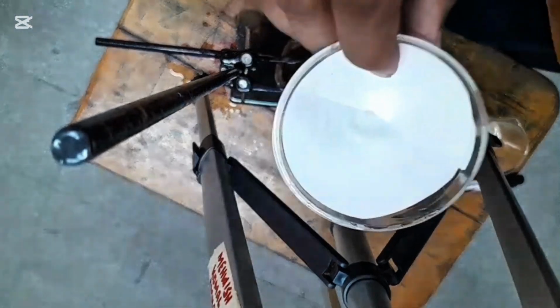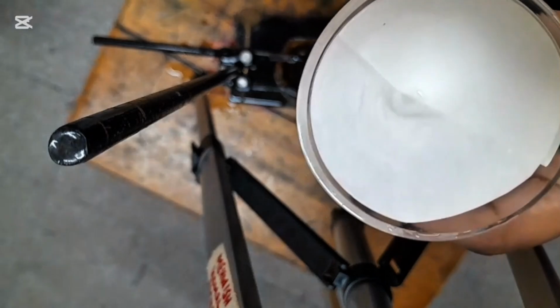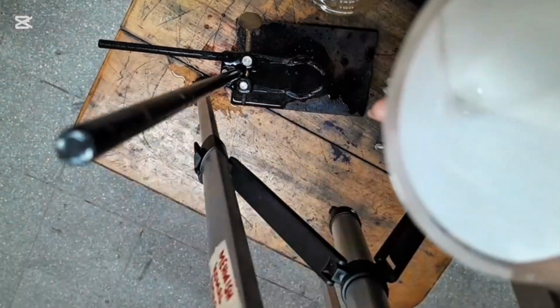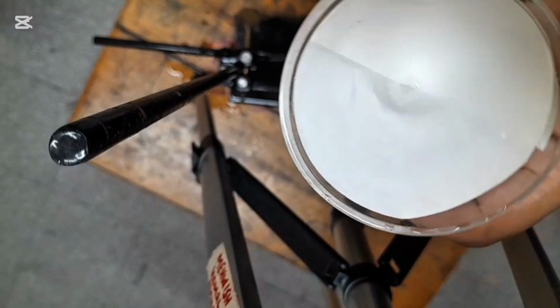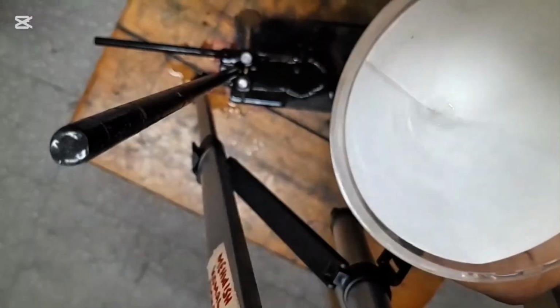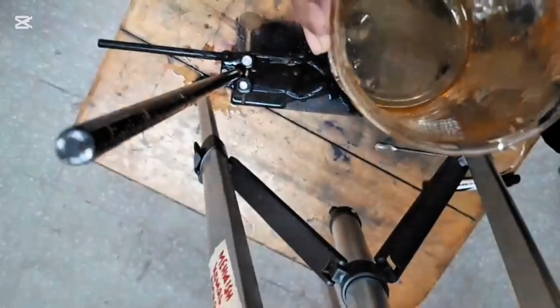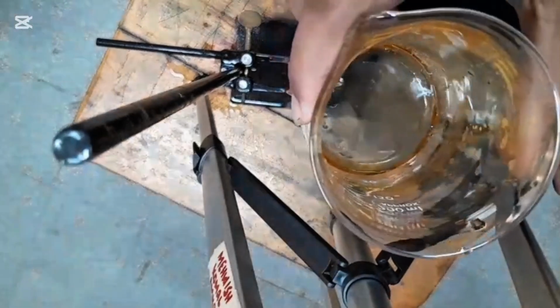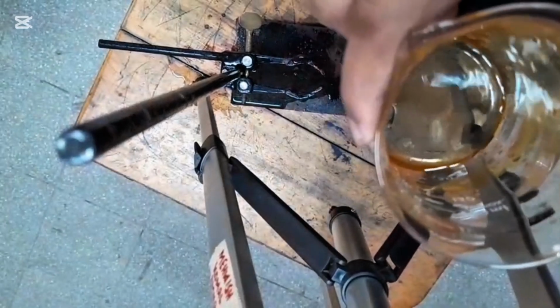So you can see all the water is getting filtered from this filter paper. This is your funnel, in which we attach a filter paper, and you can see there is nothing left attached or left as a residue on the filter paper. And this is your beaker in which the water after filtration is getting collected.